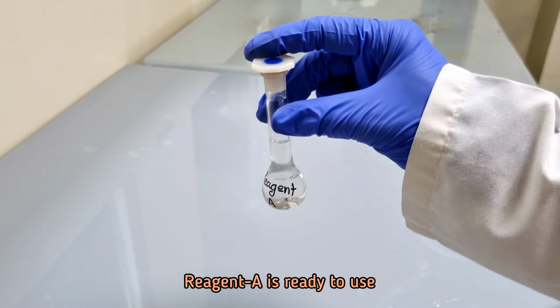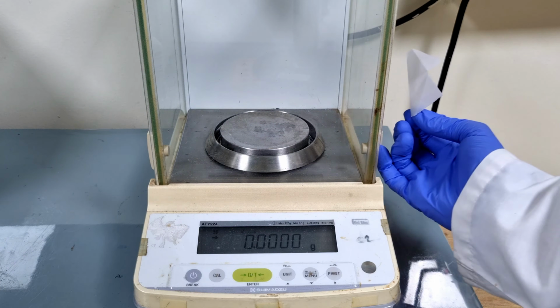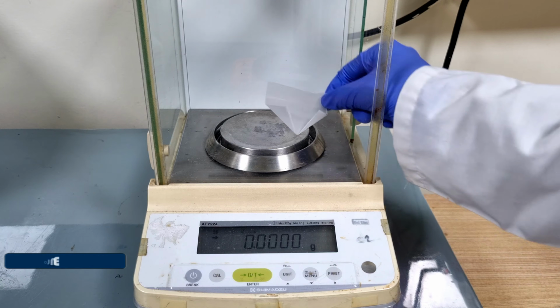Reagent A is ready to use. Let's prepare reagent B of a solution of disodium hydrogen phosphate and potassium oxalate.